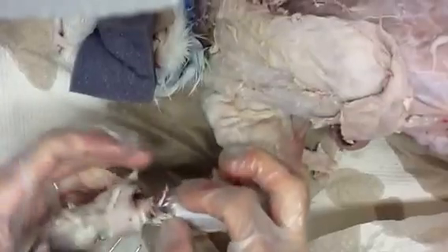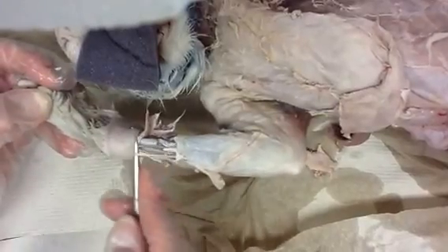I'm going to hoist the cat a little bit to show you in the video. Ann has dissected out a really nice view — trying to get down to see the nerves. You can see how shiny and iridescent that connective tissue looks on those tendons. There's one nerve right there on the side, and she got one isolated over here. This would be the cat's thumb side, so this is on the pinky side — so this is the ulnar nerve coming down on that cat.